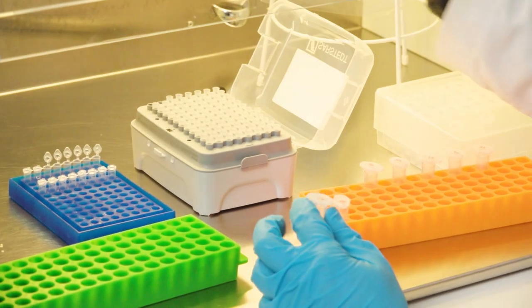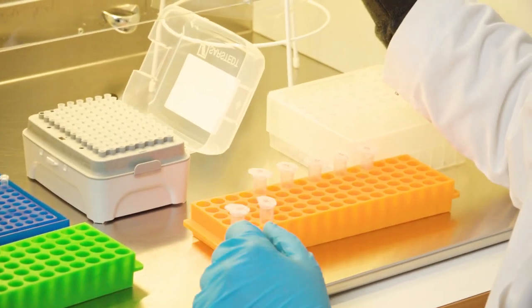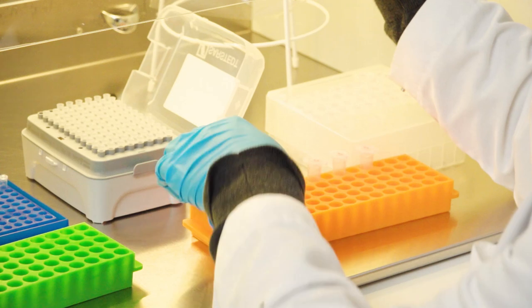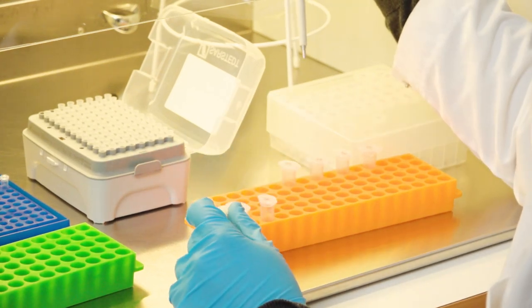Get rid of the tip, close the tube, and place it on the bottom row of the rack. And then the process continues.